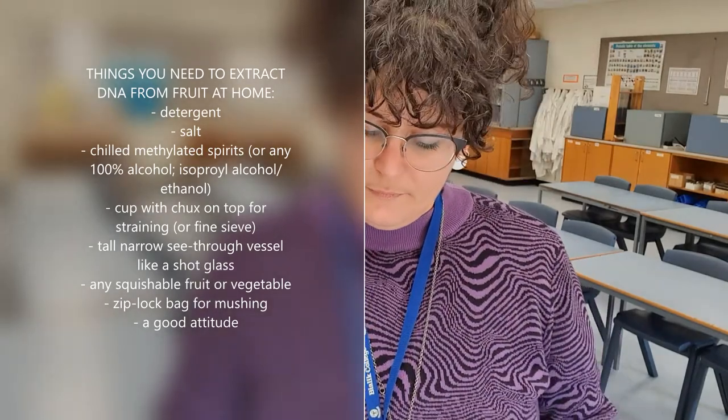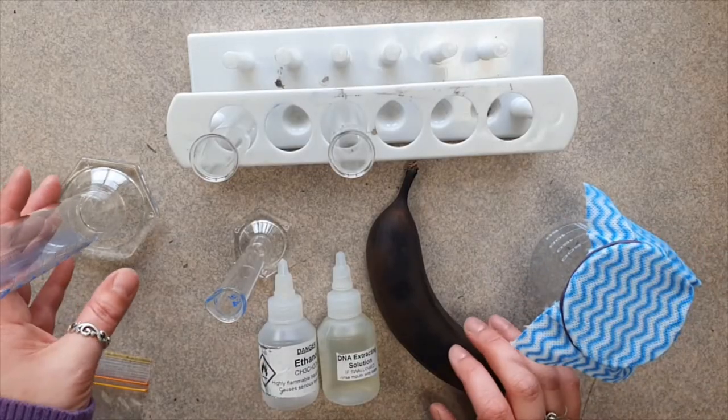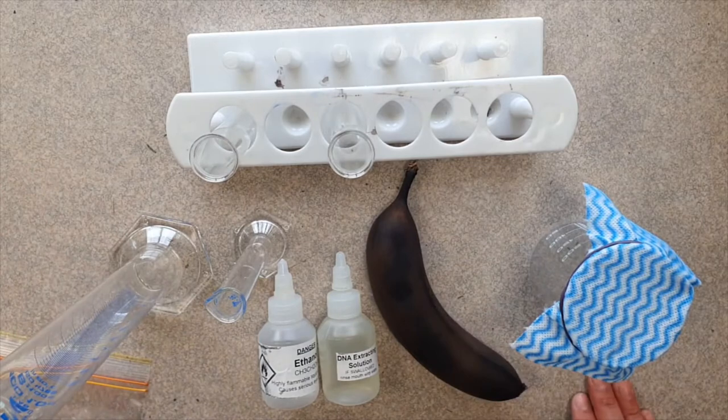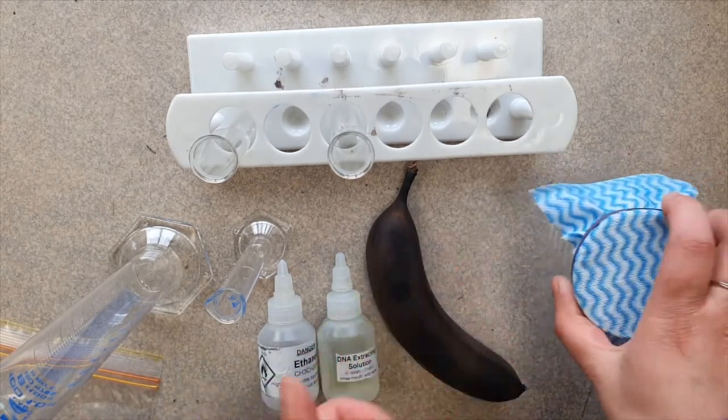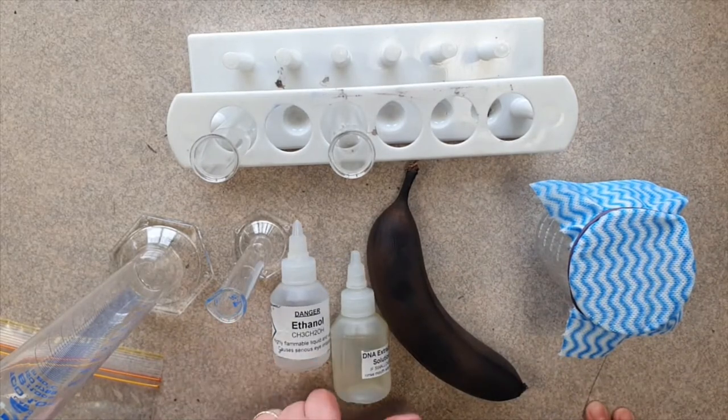All right, I'll show you what I have set up. So this is what I have. This is all you need. You can do this at home with, instead of a beaker you could just use a cup, and instead of ethanol you can use methylated spirits.